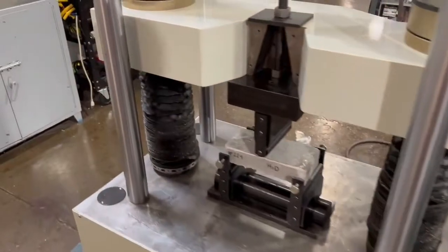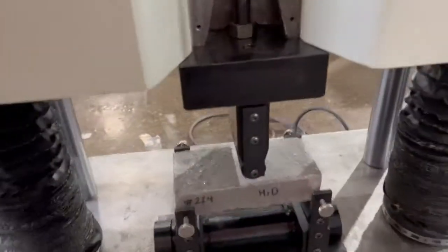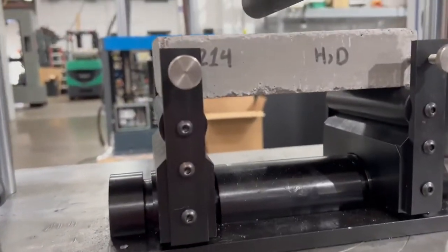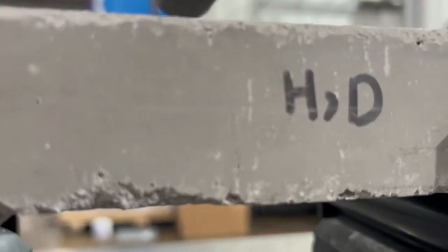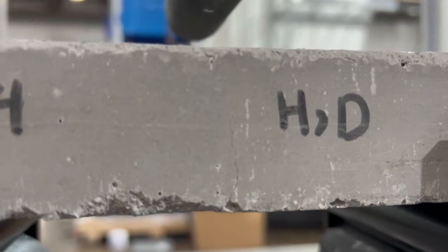Test is complete. It's going to automatically auto retract. And you can see right here, really small is a crack and that machine sensed the load and the failure point.